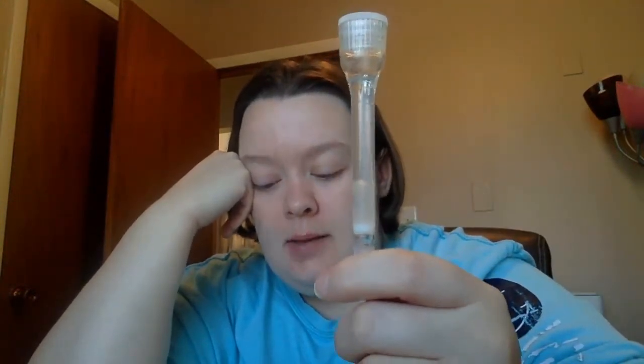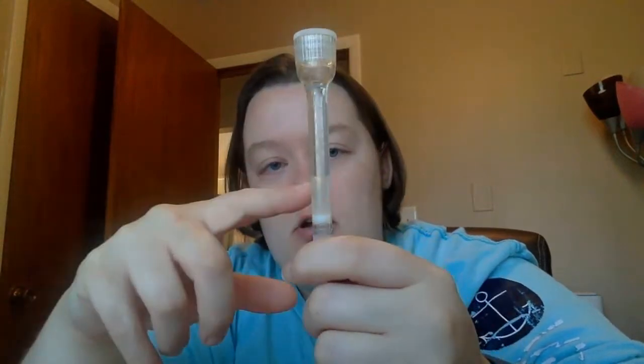So essentially what's happening here is inside of this column, where the gel part is at the bottom, we have small beads, and these beads have a fixed charge. In this case, the charge on them is negative. So what we're going to do is slowly change the pH of the substance that we filter through, and as we change the pH, the different substances here are going to bind differently.